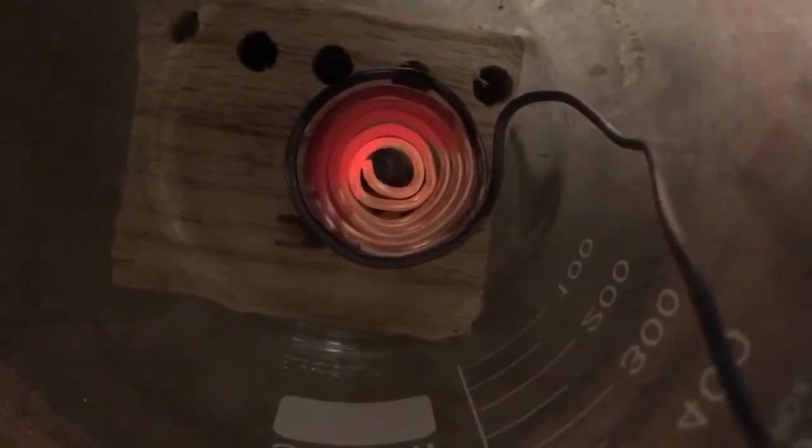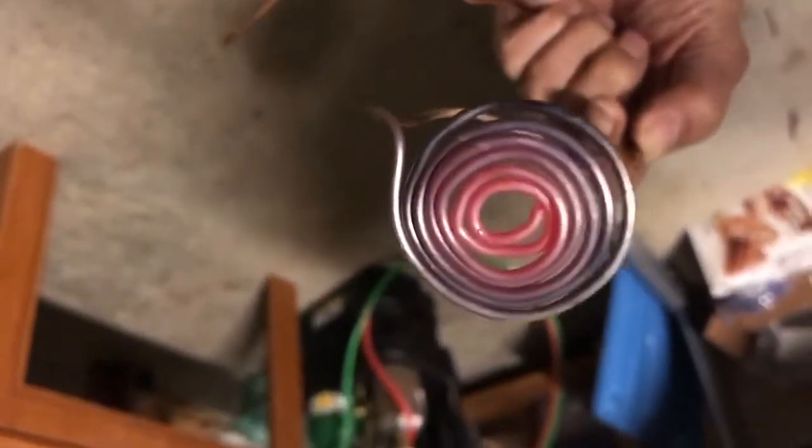I'm going to take this out and show you what the surface looks like. There it goes. An oxidation-reduction reaction taking place on the copper surface, starting right back up again. Waves of oxide followed by copper, followed by oxide.